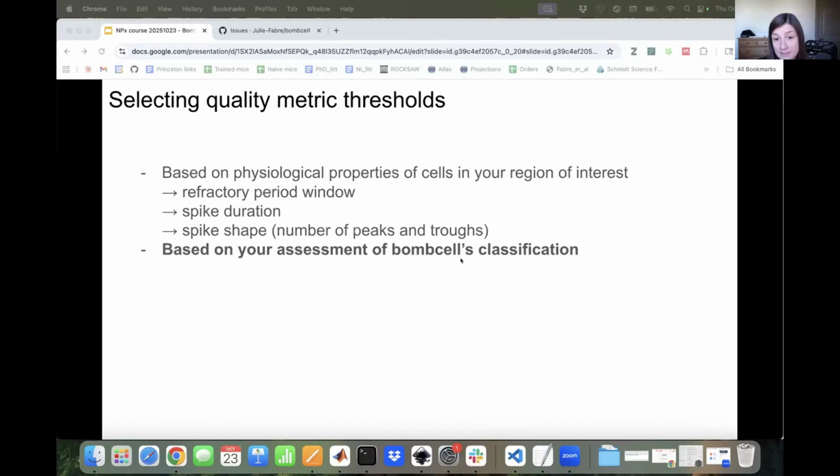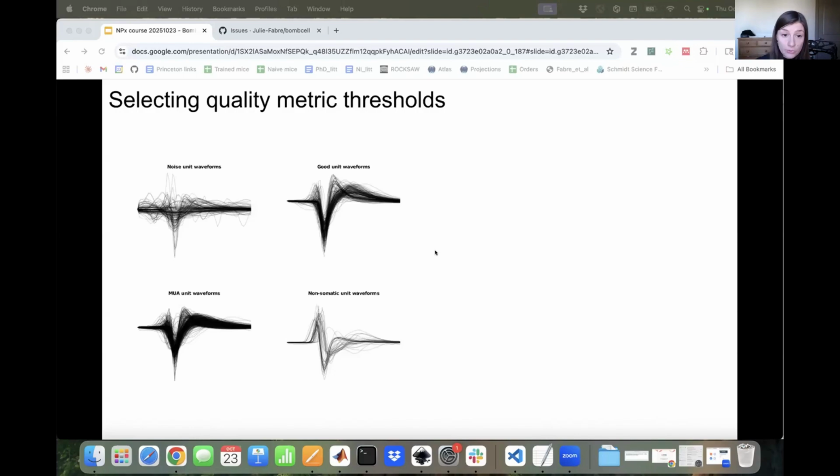You can also do it based on your assessment of Bombcell's classification. So what I mean by that is looking at what Bombcell's doing and do you actually agree, and should you adjust some of the thresholds so that it better matches how you would have classified these units. And you can do this on a few data sets and then generalize to the others. So Bombcell outputs a few plots. It will show you all the waveforms of units that have been classified as, for instance, noise, and you can see that most of these do indeed look like noise, or more as good units and non-somatic units. And this is a quick way of seeing, in the good unit category, for instance, are there any units that actually look like they're noise, or am I missing a lot of good units that are classified in the noise category? And this would be pointing you towards you should look more at these metrics and potentially adjust the thresholds.